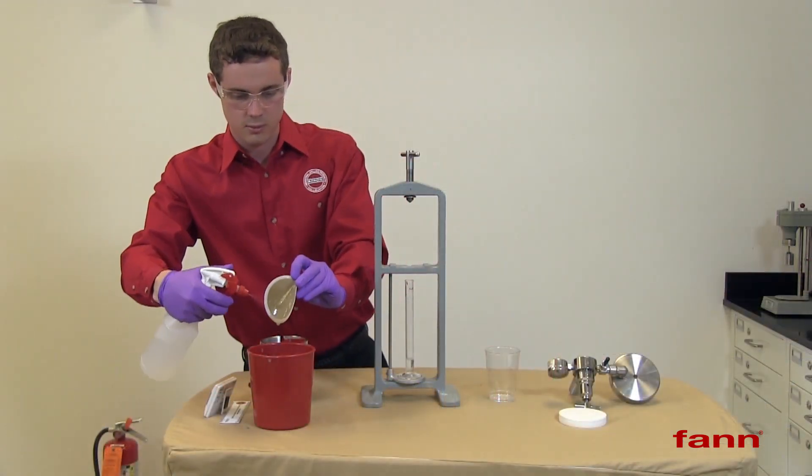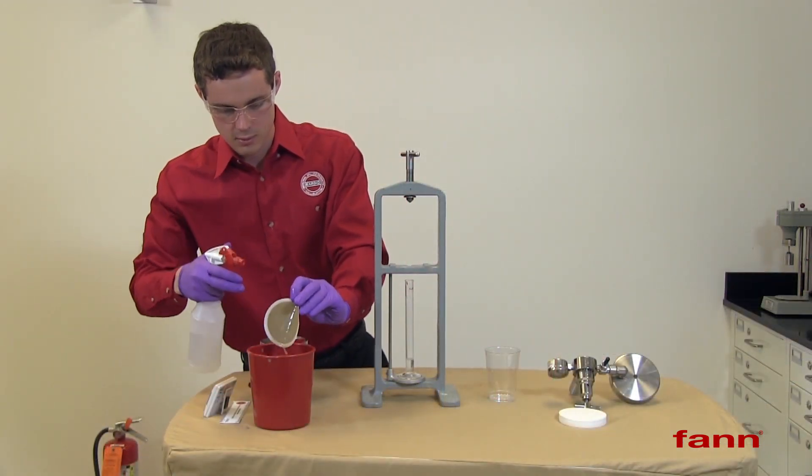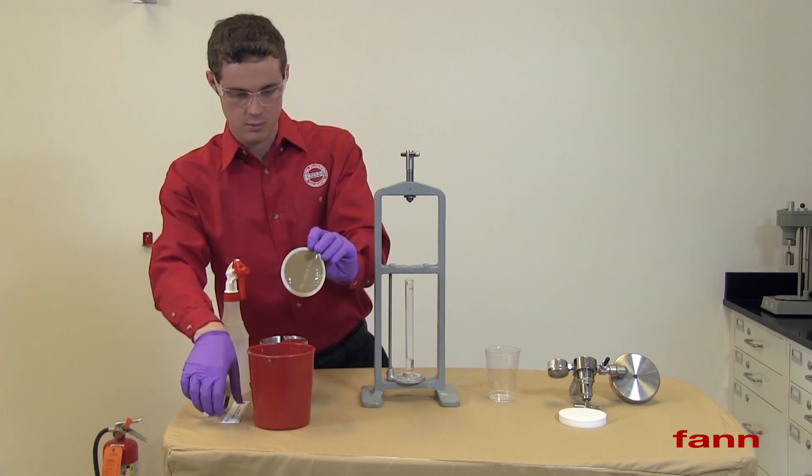The solids left on the filter paper is the filter cake. Rinse the cell and the filter cake.